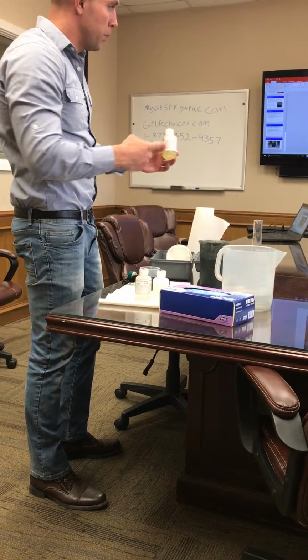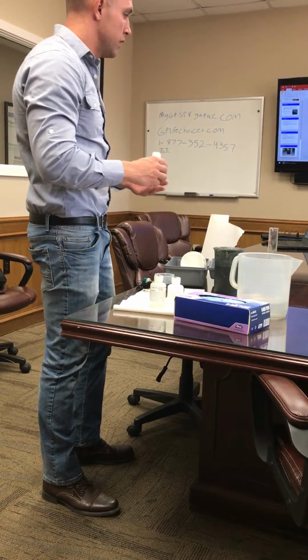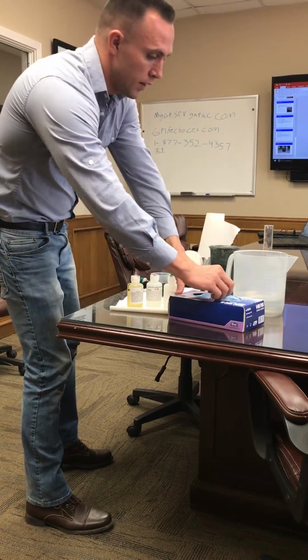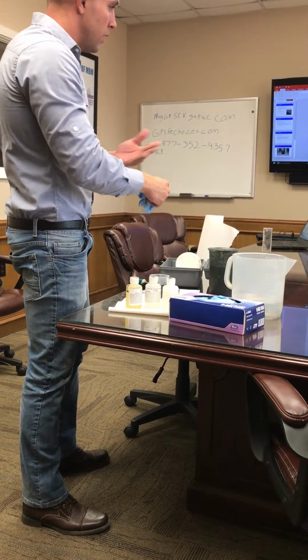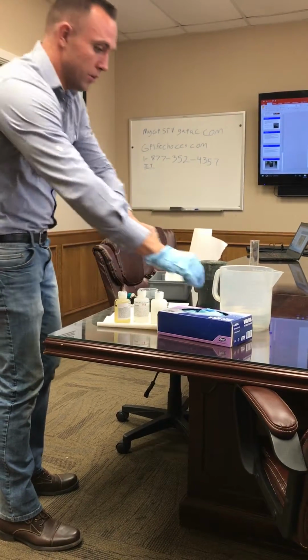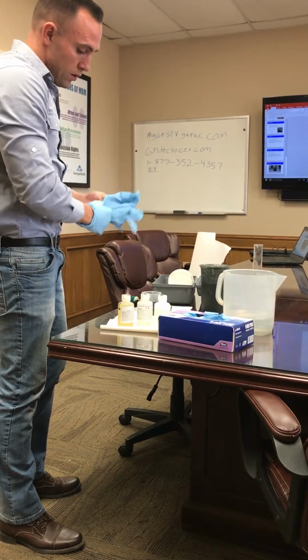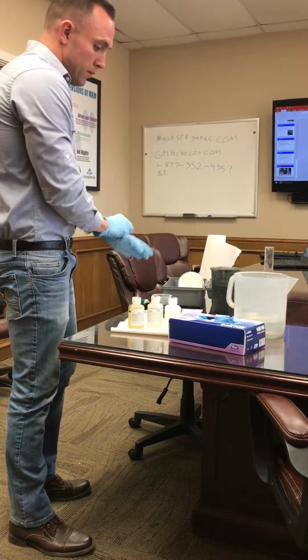This is the first chemical, your Polymac. I recommend wearing gloves with this just because it's kind of acidic. I've had it before where I've got some on my arm and I've wiped it off and my hair came out. So just as safety, wear some gloves. Same thing with the caustic too. I've got that on me. You get some burns on there.